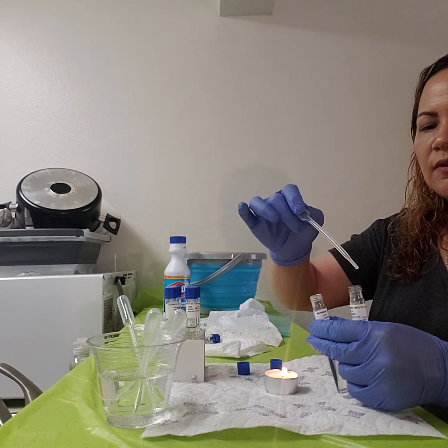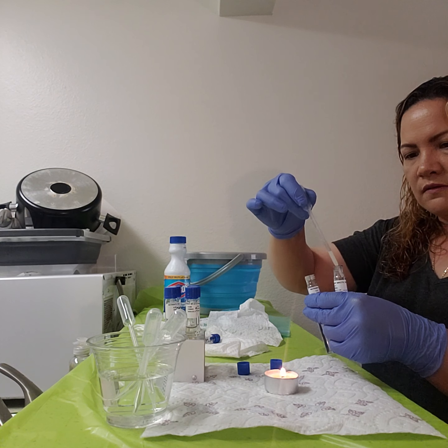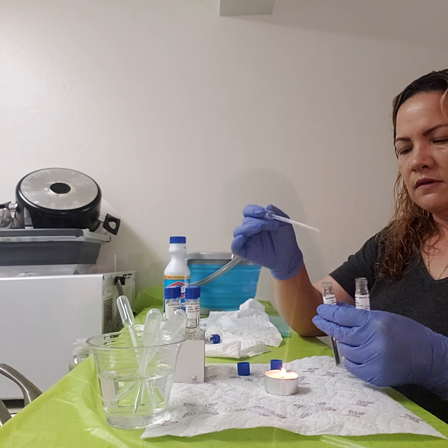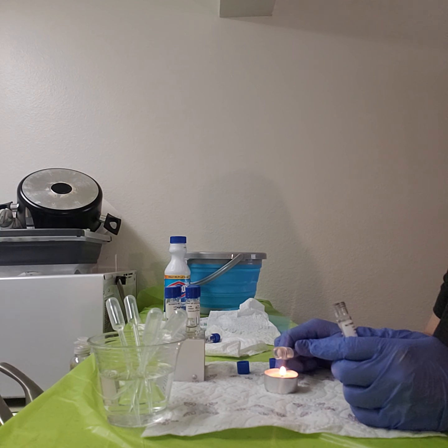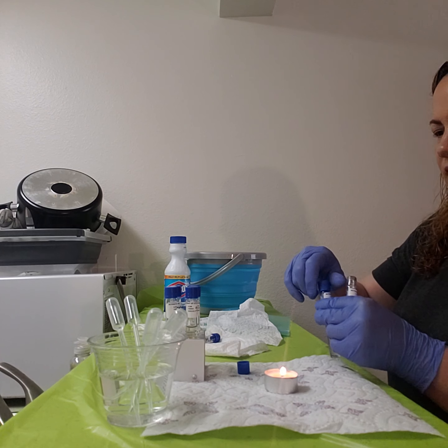So just to remember. Okay, so you're going to put 2 drops of here. So inside here, 1, 2. Okay, and then we'll sterilize that. Okay, now let me go ahead and do this one. Okay, so that's pretty much done.